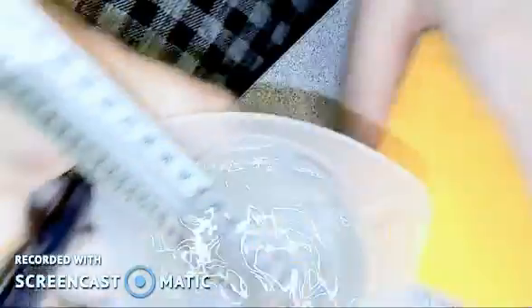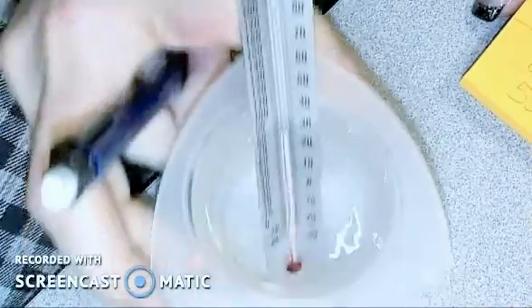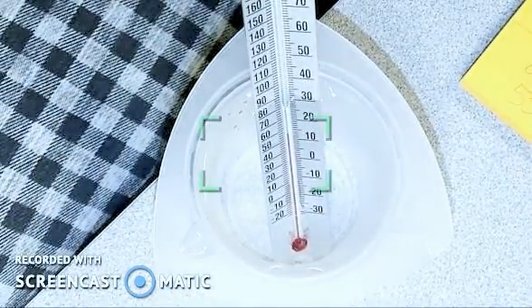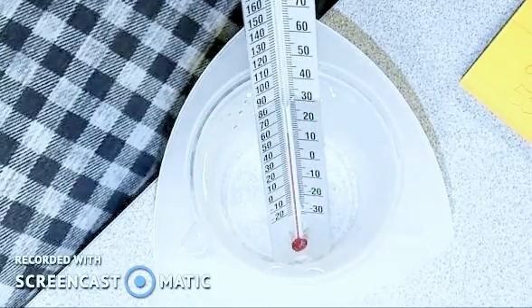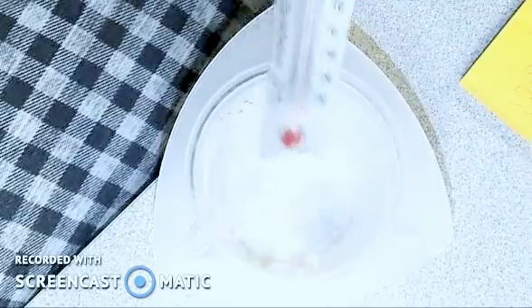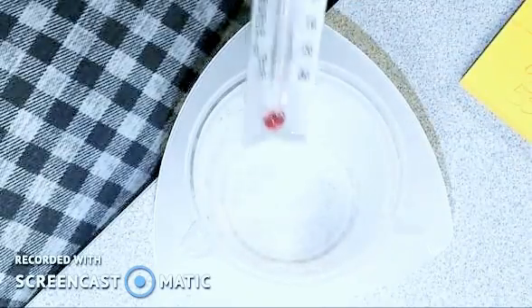All right, so the next one is my 14 degrees here. 14 degrees, yes. And get those timers ready. Clear them out. Again, remember, you can always pause the video if you think I'm going too fast. I'm going to remove the thermometer.